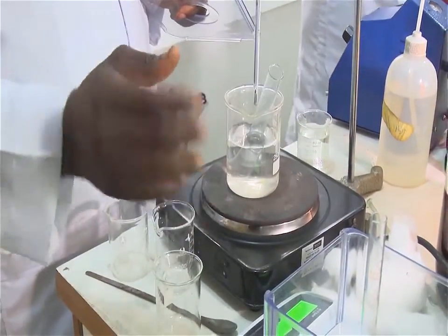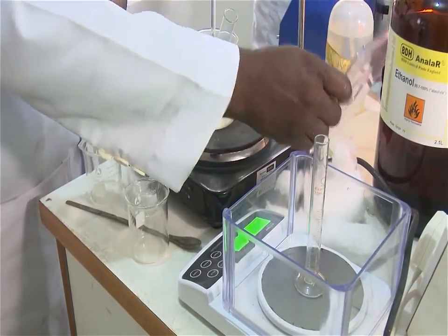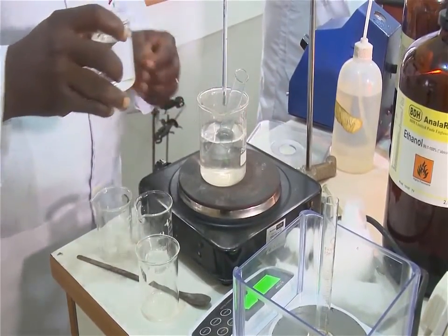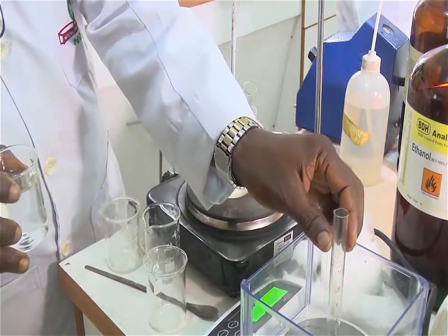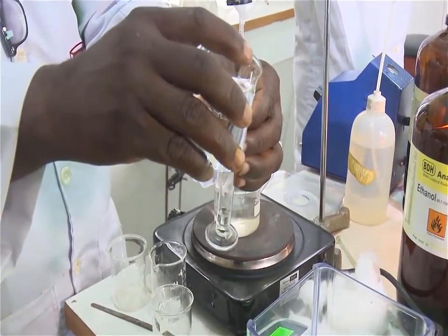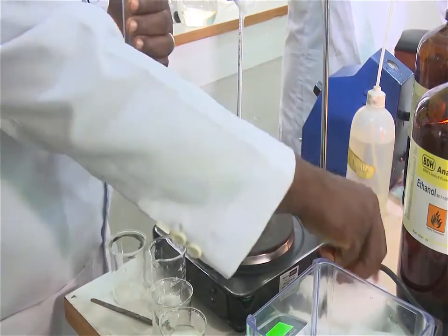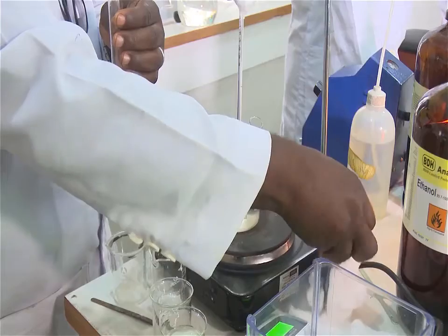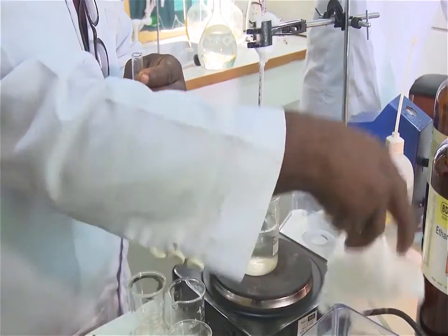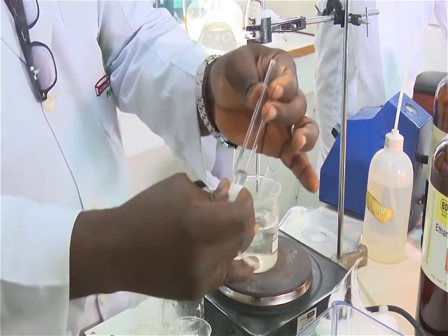Now, add water from the beaker to the cylinder so that the level is above 5 ml but below 10 ml, and record the volume accurately to the correct significant figure. Wipe off any water droplets adhering to the outside as well as above the water level inside. Record the mass of the cylinder with water.